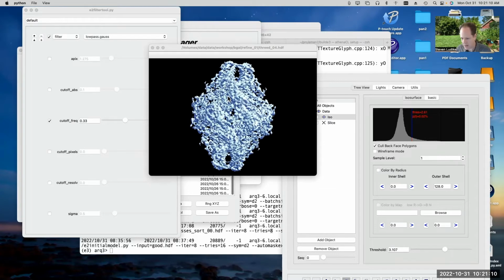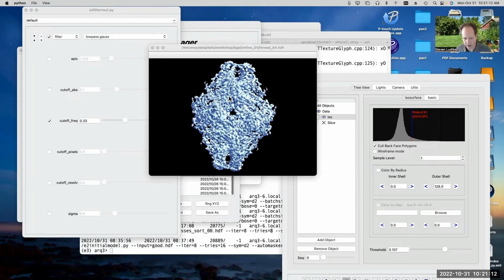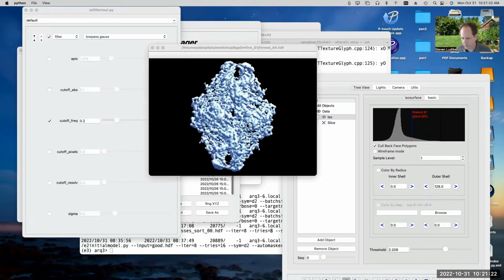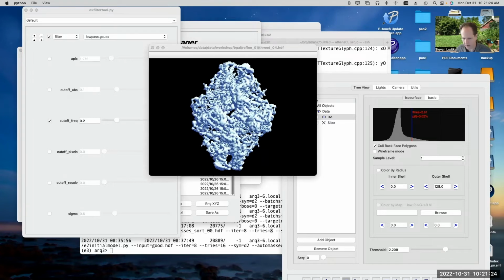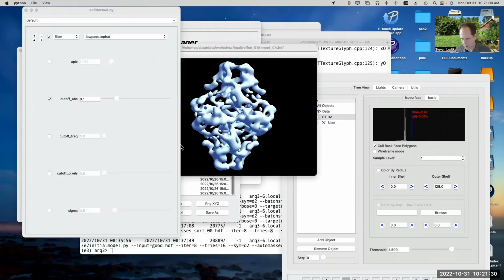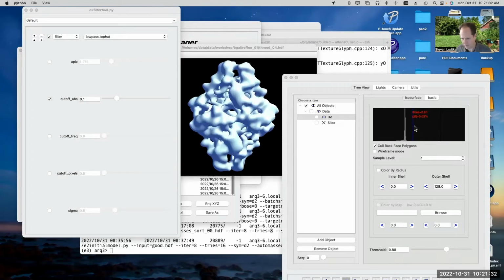The downside of doing top hat filters is they also produce ringing artifacts. So if we do, let's see, 0.5 here. Sorry, not 0.5, that's 0.2, so 5 angstroms. So a 5 angstrom Gaussian low pass filter. We can compare that to a low pass top hat filter, and you can see some of the nasty stuff that it does to the structure.